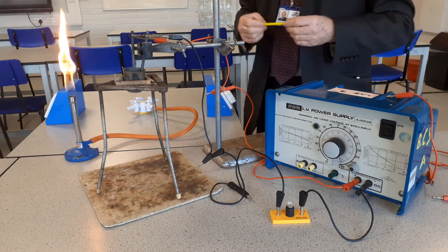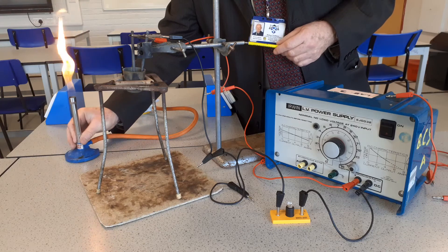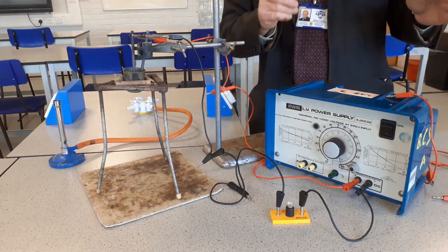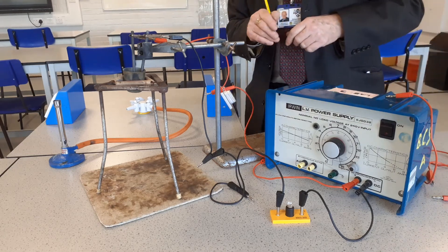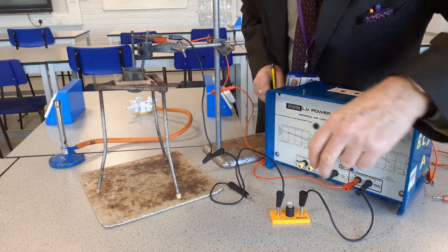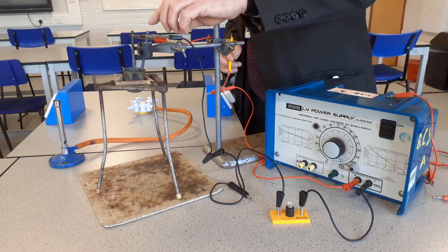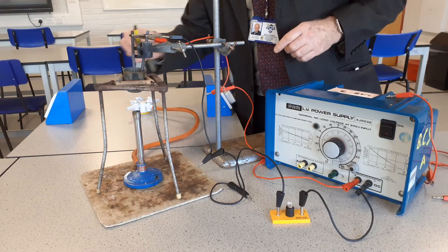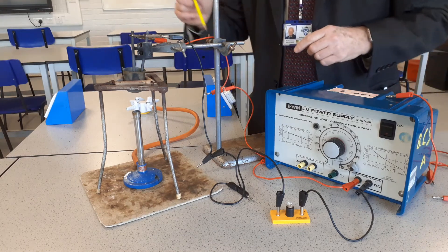I'm going to look at the electrolysis of molten lead bromide today. The apparatus I've got is as normal — I've got a power pack which is set on DC to ensure we get electrolysis. The black leads connect to a carbon electrode which is called the cathode.